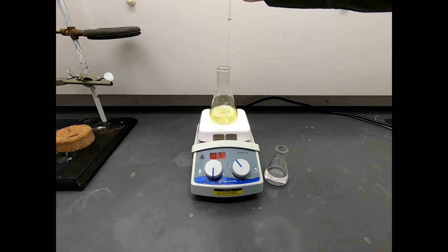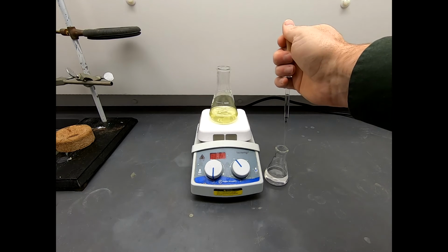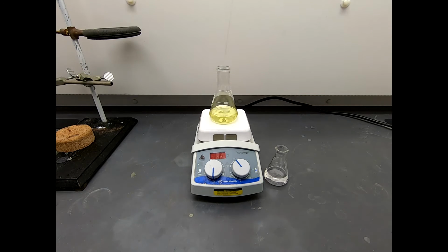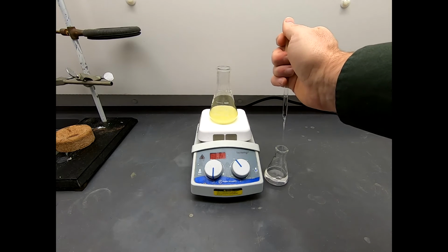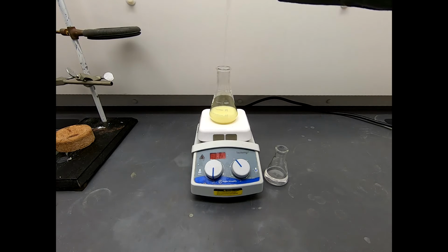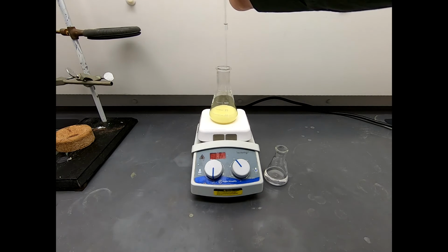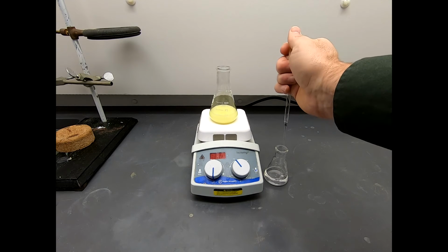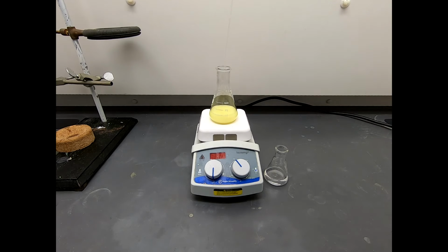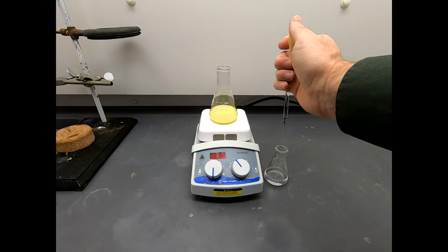Now, as a general rule of thumb, one of these full pipettes, this is a 9-inch pipette, holds about 2 milliliters of liquid. So I'm not getting any more than 2 milliliters of liquid per squirt. So it's going to take 15 or more squirts. Oh, okay, there, I don't know if you were watching, but the solution had gotten darker and yellow, and now it's getting cloudy. So now we're forming something that is insoluble, or not very soluble, in our reaction medium. And that's a good thing, because we expect our product not to be soluble. Now, it could be the intermediate, the monoreacted material, but at least that's the first step to getting our final product.